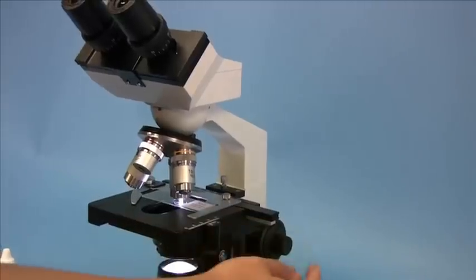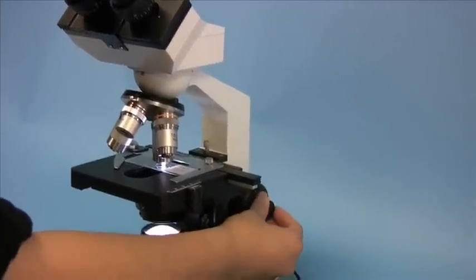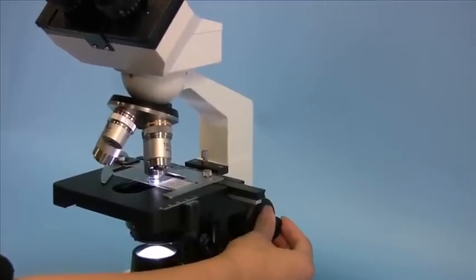Now only use the fine focus adjustment knob to get the image focused.